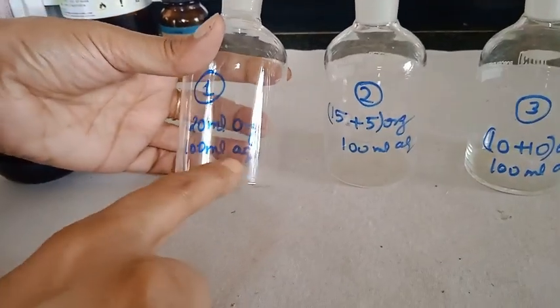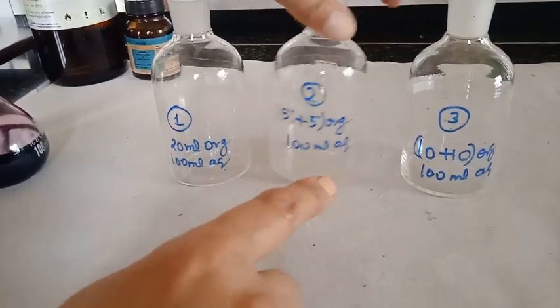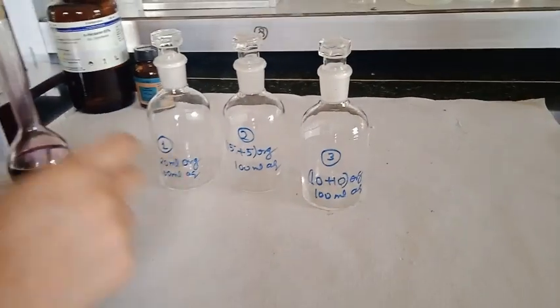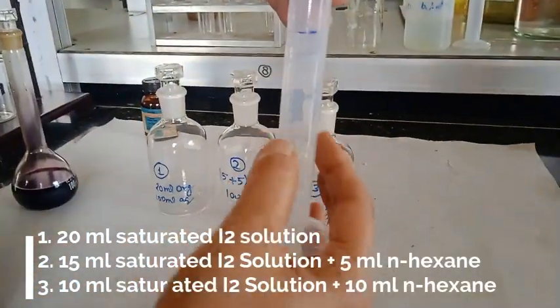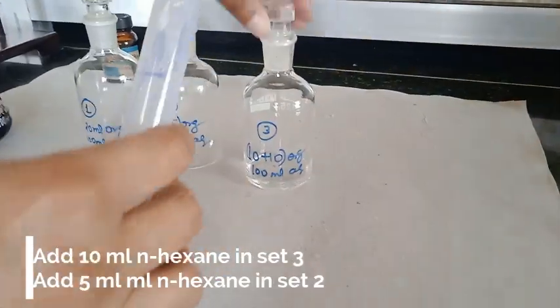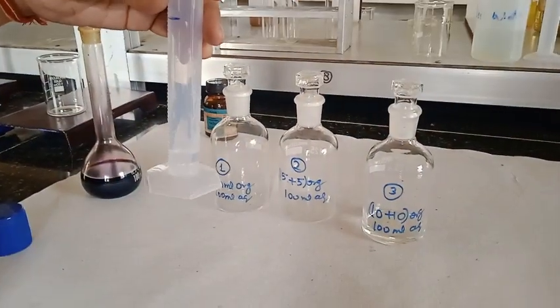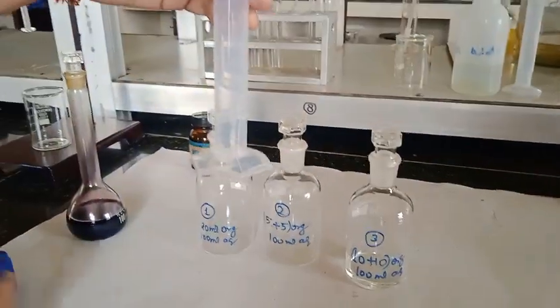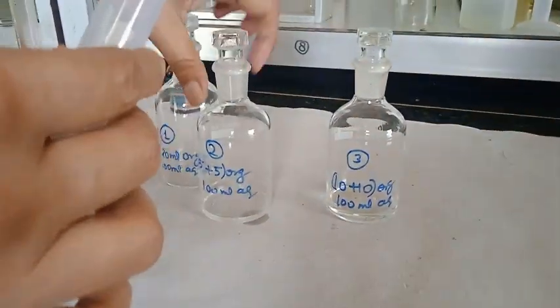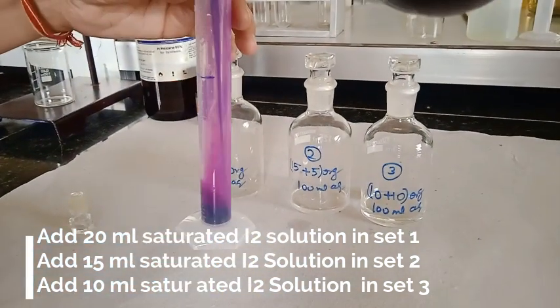Here 15 ml of this saturated iodine solution plus 5 ml of n-hexane. Here in the third set 10 ml of saturated iodine solution and 10 ml of n-hexane. So first I am going to add 10 ml of n-hexane to the third set and now 5 ml of n-hexane in the set 2. And now I am going to take 20 ml of saturated iodine solution that I am going to transfer in the set 1.